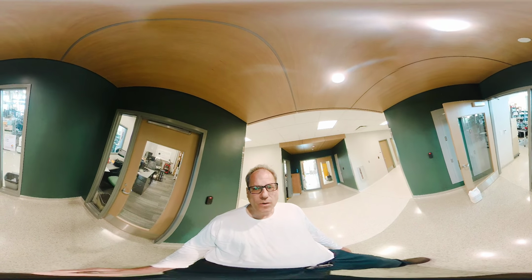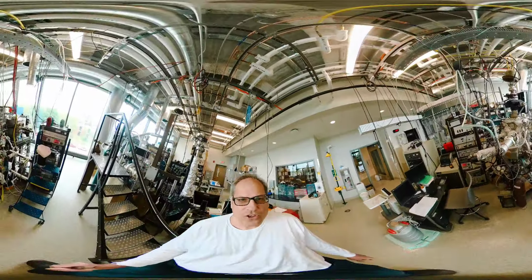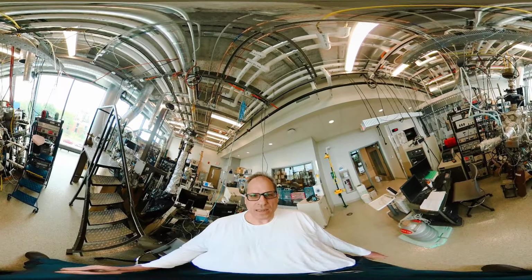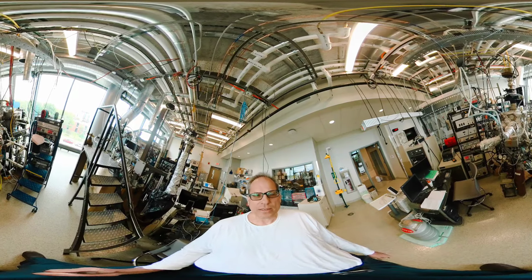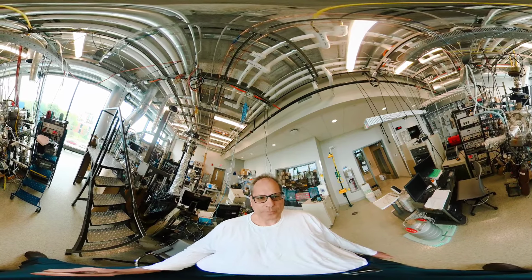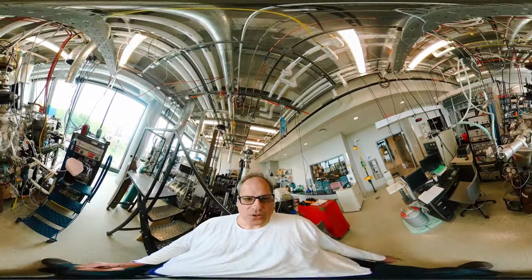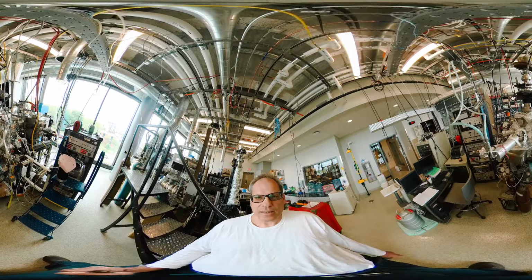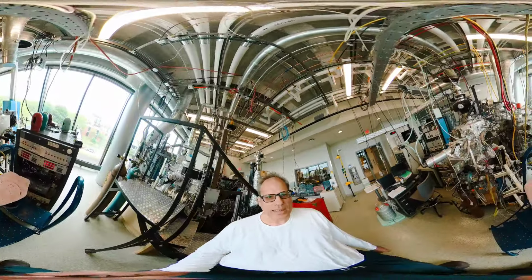And we can walk to the last one here. It's a fairly large system, consists of 2 chambers, and that's a molecular beam scattering system. It's similar to a laser, but instead of a light beam, we're generating a particle beam. The noise in the background is generated from the pumps we need to drop down the pressure. Also that system has an X-ray spectrometer, an XPS system, and it has some mass spectrometers, gas dosing, and metal evaporation systems. And that part here is actually generating the beam.